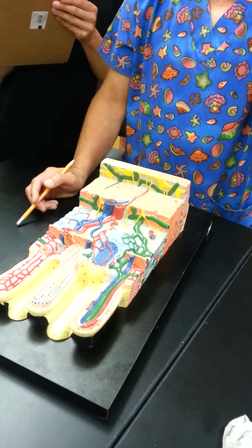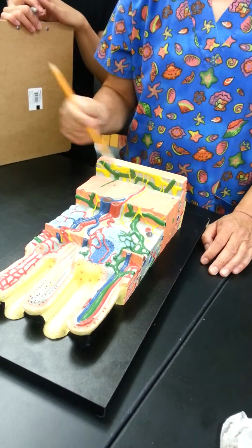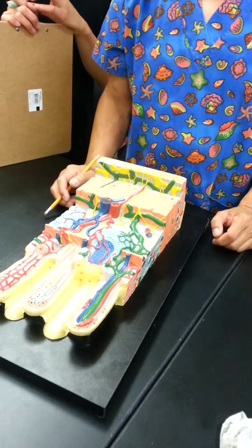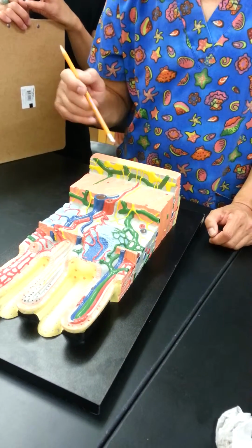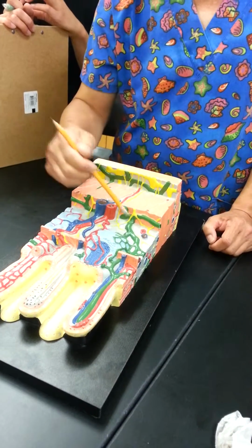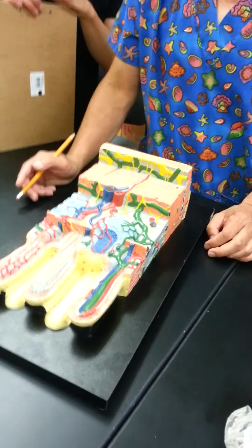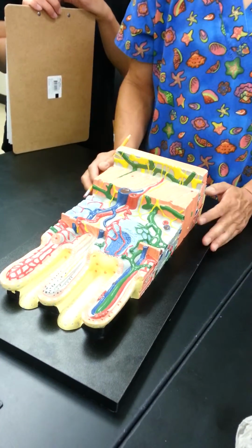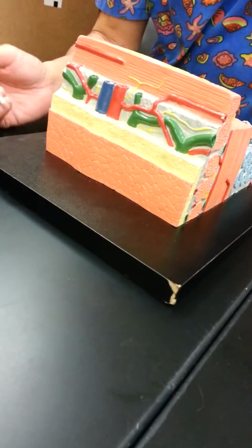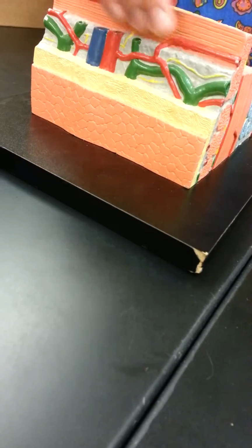Muscularis externa, okay? These are many cell layers thick, smooth muscles. Inner circular layer, outer longitudinal layer. Inner circular layer does segmentation, outer longitudinal layer does peristalsis. And whatever yellow things that you see here, the ones down here, that would be the myenteric plexus. And whatever goes beyond that, going to here, would be the submucous plexus or submucosal plexus, or Meissner's plexus. And then here you have your serosa, which is always going to be simple squamous, and it will be supported by connective tissue as well. I've seen these ones also labeled as lamina propria.